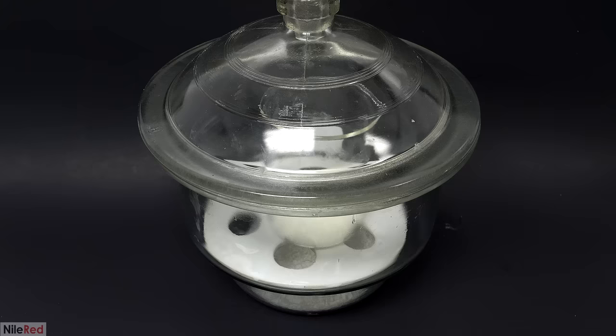All the nice red powder was dumped into a beaker, and I added a thermometer. Then I started adding 500 mils of a dilute potassium hydroxide solution. The procedure called for 700, but because my yield was significantly lower, I didn't think I needed to use that much. I honestly have no idea why I tried going with a black background here, because after adding just a small amount, I realized the contrast was going to be horrible. So I quickly swapped it out for a white one and continued the addition. I brought it up to about the 500 mil mark, and then I turned on the hot plate. The goal was to heat it, but not to the boiling point, so I brought it up to around 80°C.